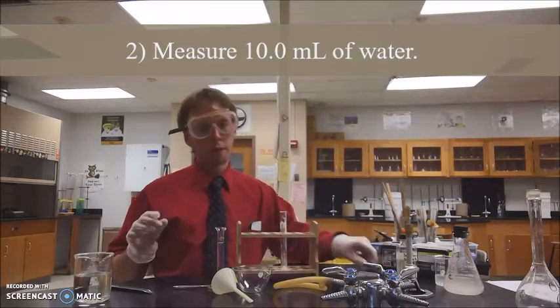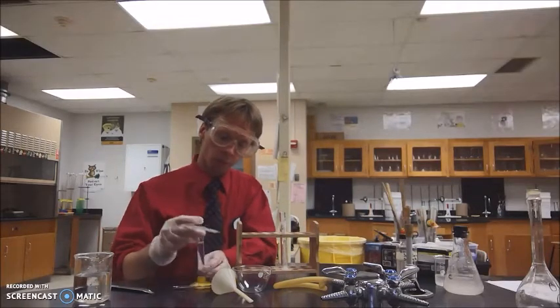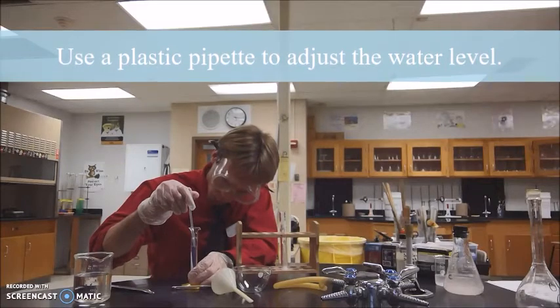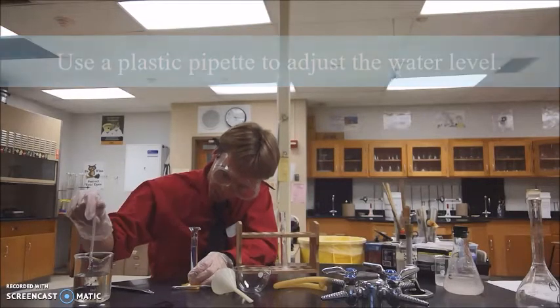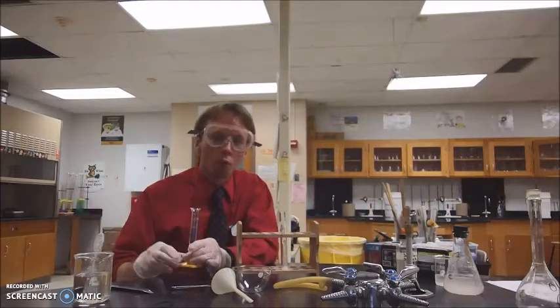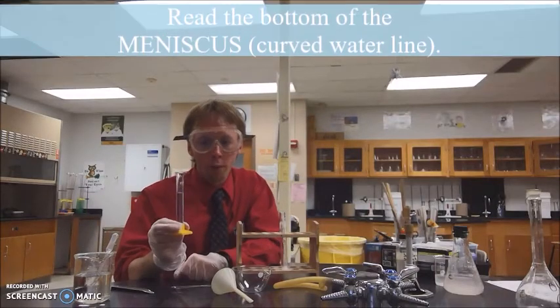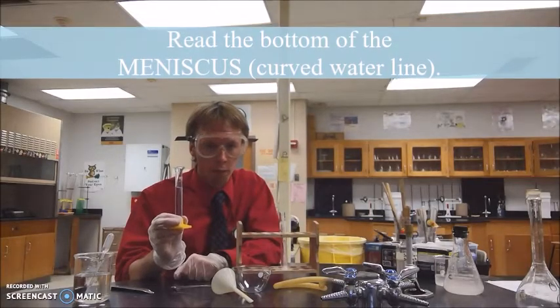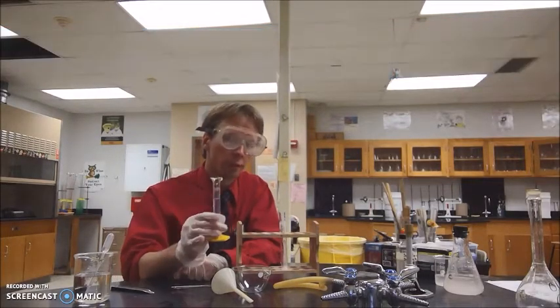And I overshot my 10 milliliters there. So I'm going to use a plastic pipette to help lower my volume until I get exactly 10 milliliters. Remember that you're looking for the bottom of the curved line. That's our meniscus, and that tells us the exact amount of volume we have in the graduated cylinder.